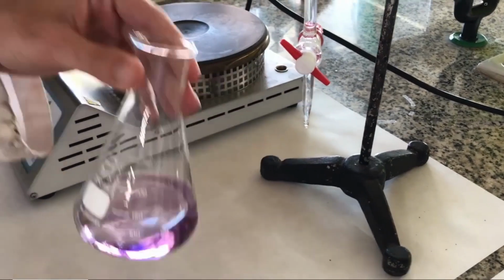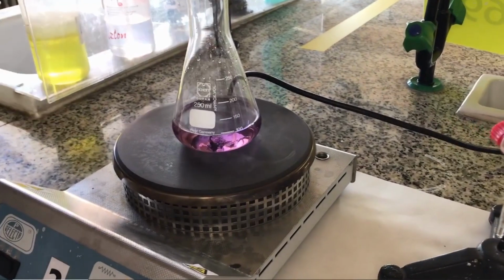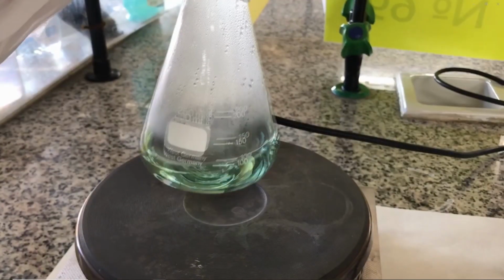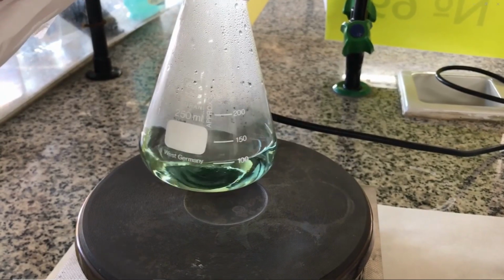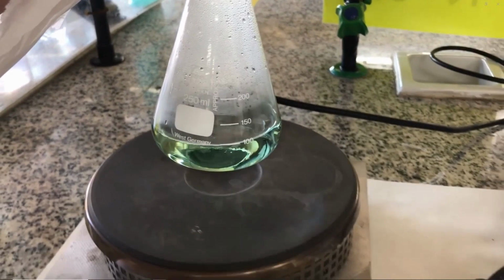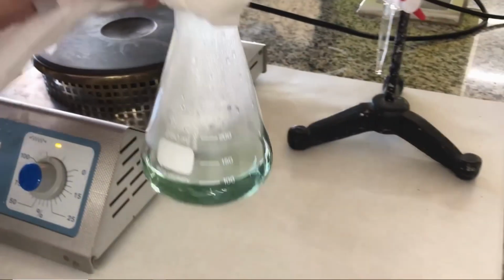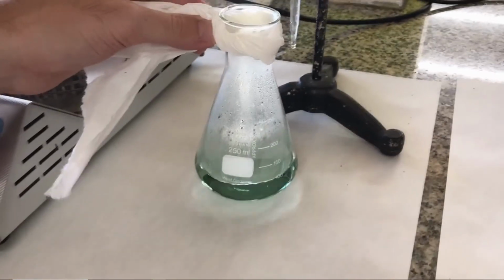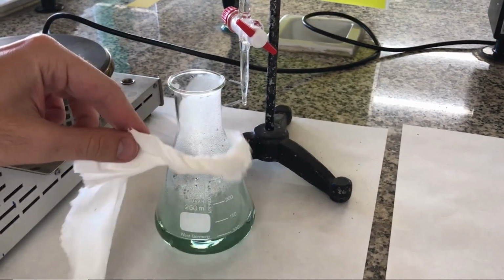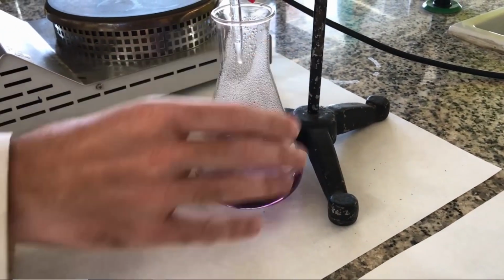Next, the solution is boiled for 2 minutes to remove the generated carbon dioxide, observing as the violet color of the solution changes back to the initial green color. According to Le Chatelier's principle, by removing one of the products of the titration reaction, a further reaction shift towards products formation is achieved. After cooling the flask, the titration is resumed until the violet color is observed again, so the titration has finished.